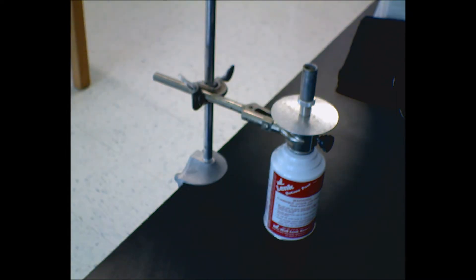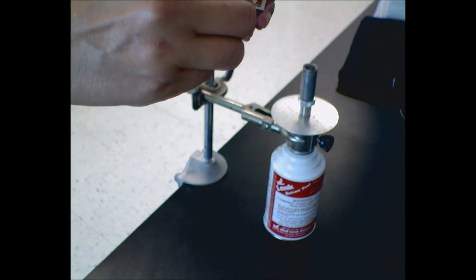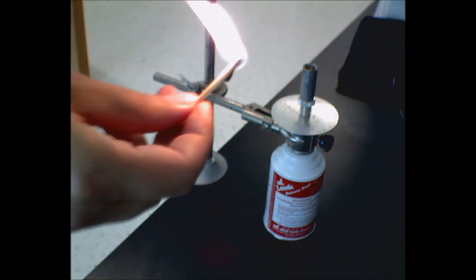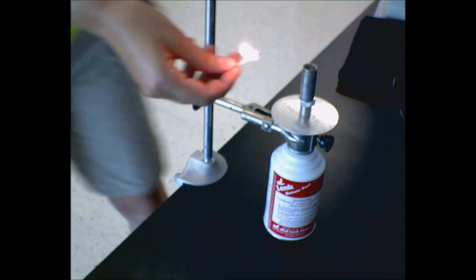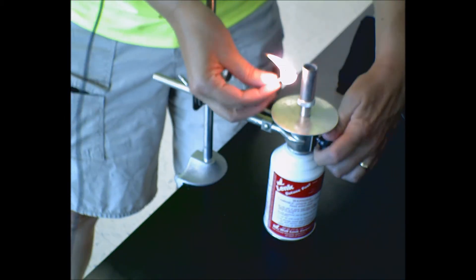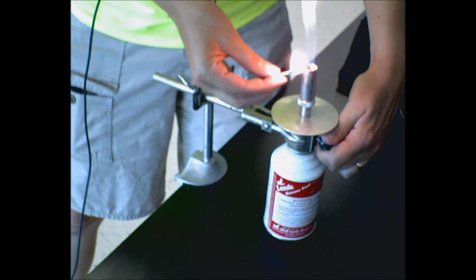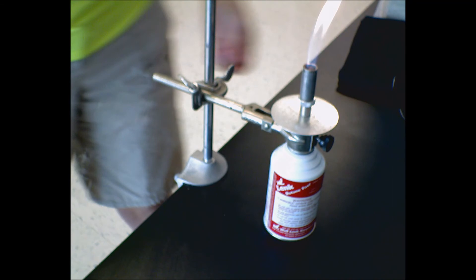If you're going to use the match, you strike it and light it before you have the gas on. And you bring the flame to the side. You can tell I have the vents on today. And you don't have your head above it.